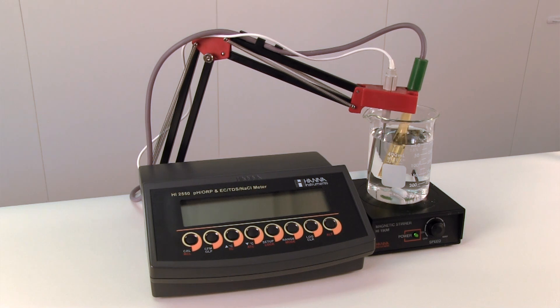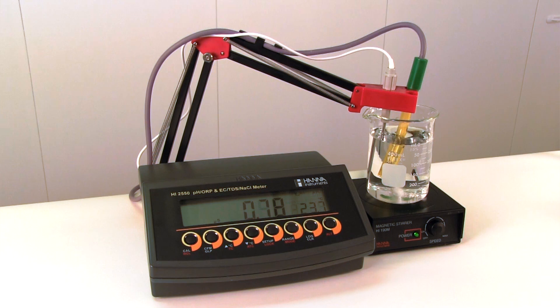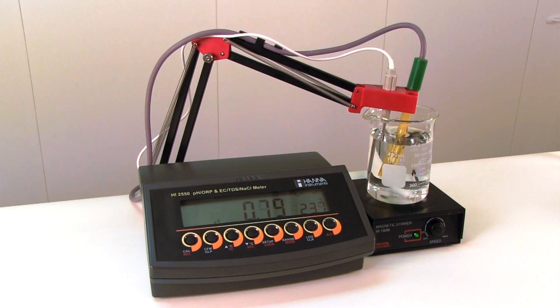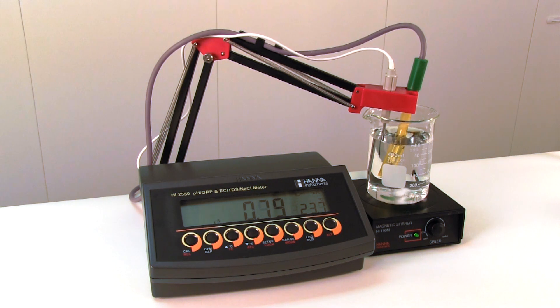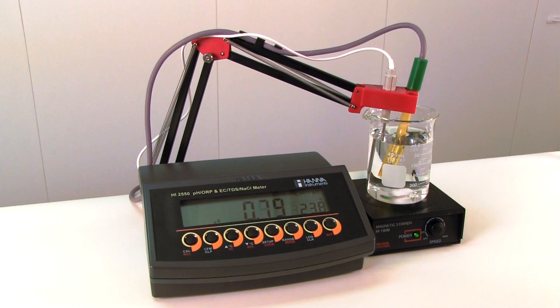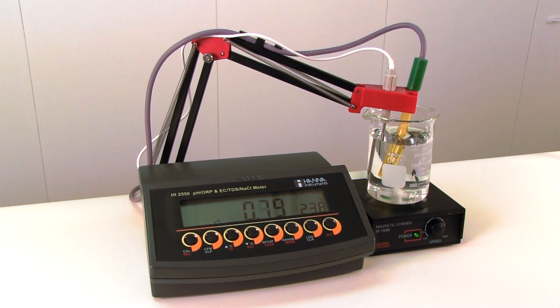So let's measure the conductivity of a 300 milliliter sample of purified water. As you can see, the conductivity is 0.79 microsiemens per centimeter. This is a very low number. It is not quite zero because despite being put through a purification process, it still has some impurities present.